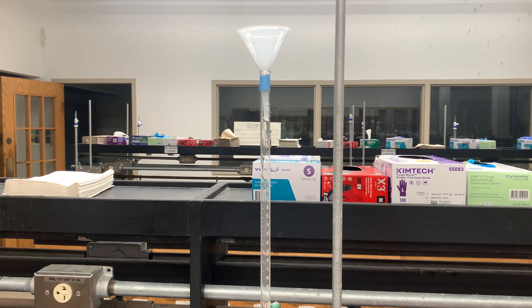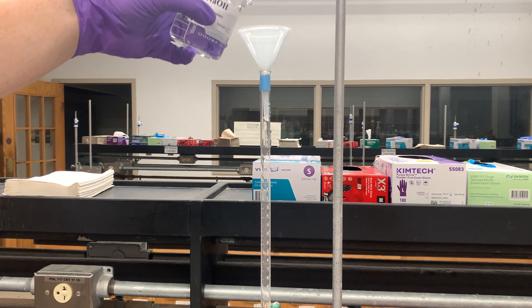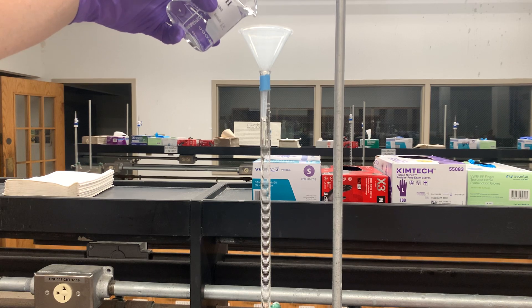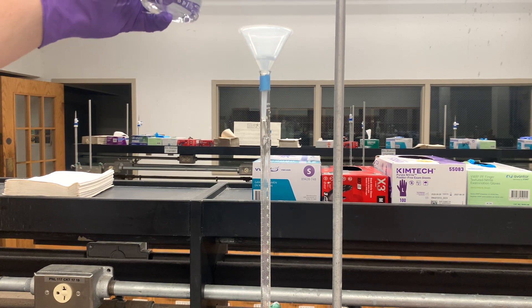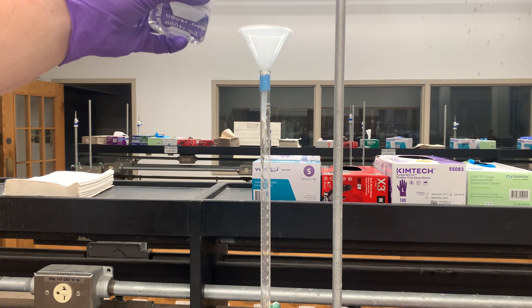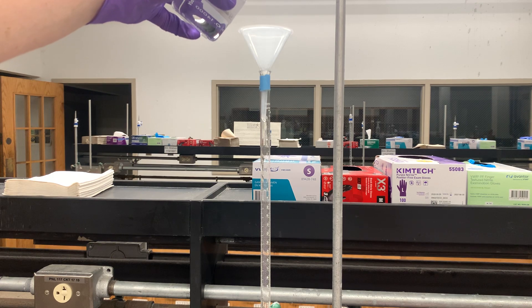What I'm trying to add is a sodium hydroxide solution. I have my one molar sodium hydroxide solution and I'm going to add it very gradually to my burette. I know that I want to ultimately add about 50 milliliters, but what I'm going to do is add a little bit and let it rest so that the burette begins to fill up.